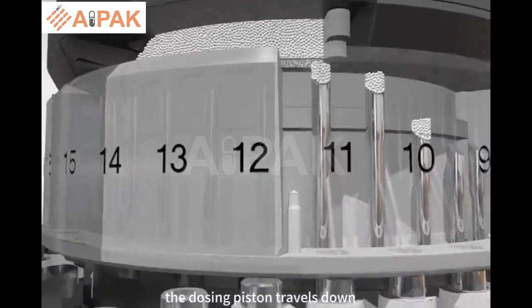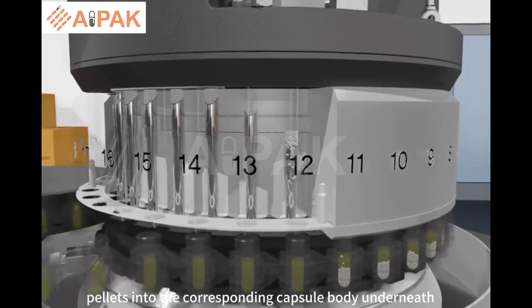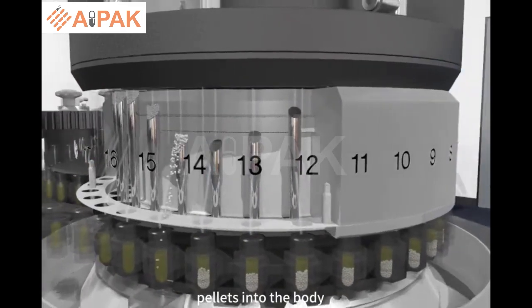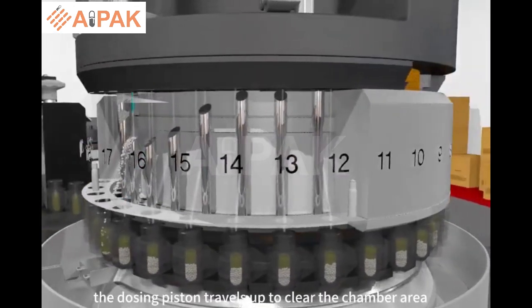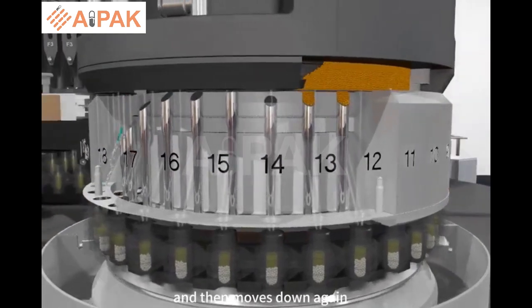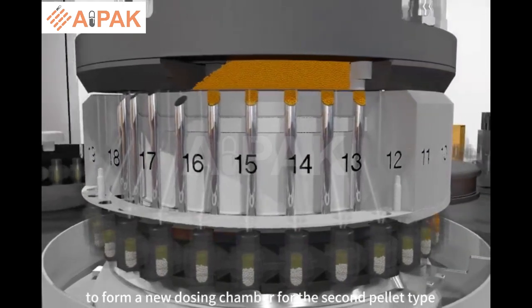The dosing piston travels down to discharge the pellets into the corresponding capsule body underneath, while a soft air pulse helps to move the pellets into the body. As the dosing ring rotates, the dosing piston travels up to clear the chamber area, and then moves down again to form a new dosing chamber for the second pellet type.